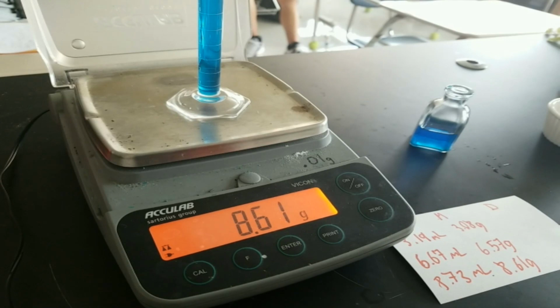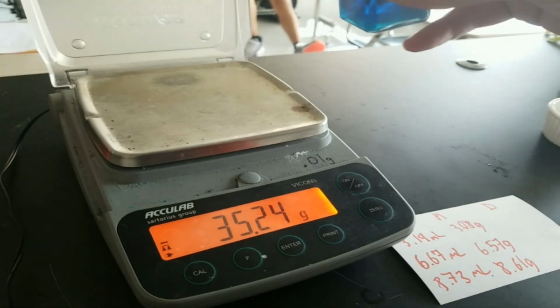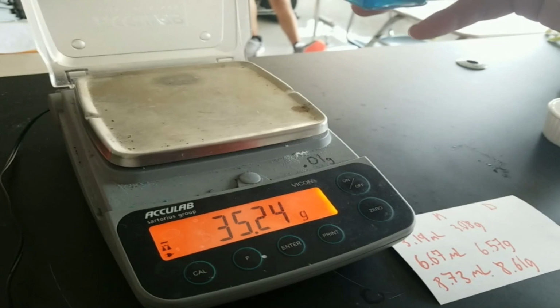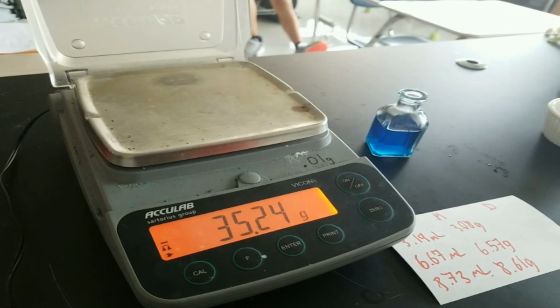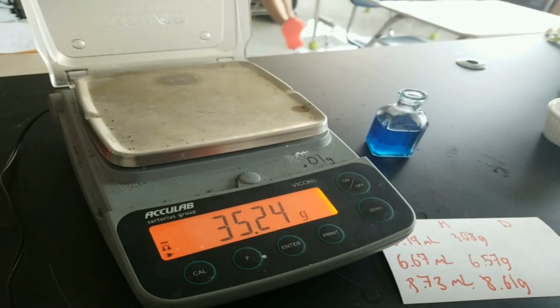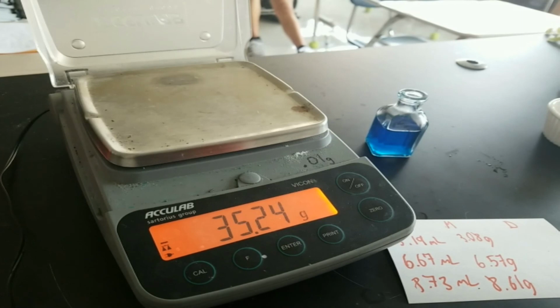And that's that. When you are done, talk to the teacher about disposal. These chemicals are just going to go back into the container that I got them at, so that way I can use them again and again, as these ones are not volatile. So there you go. That is how you do density of a liquid. I know I did not calculate the densities here. I can do that later. That's again just mass divided by volume. And then you're going to get the average. You're going to take all 3 of them, add them together, and because there's 1, 2, 3 data points, divide it by 3. So that is our whole getting density via a liquid.